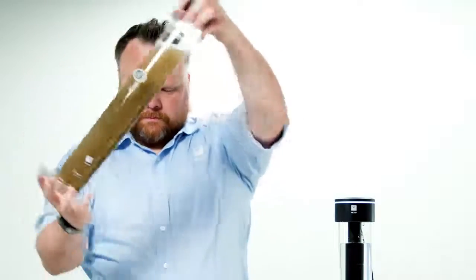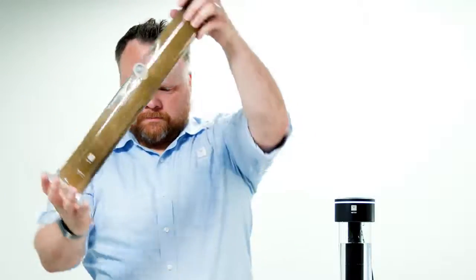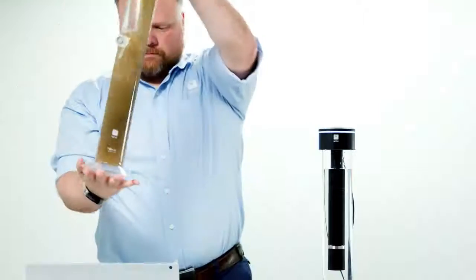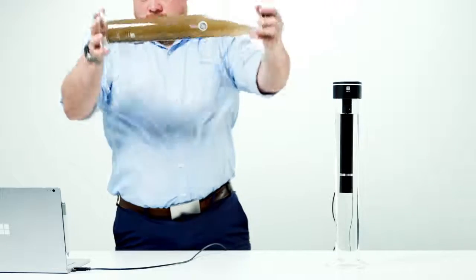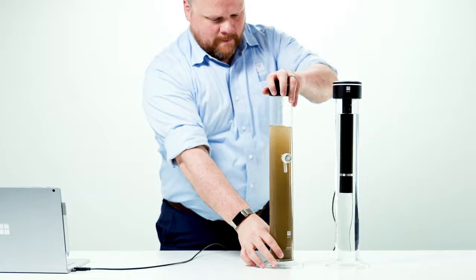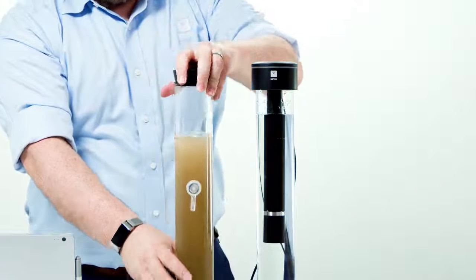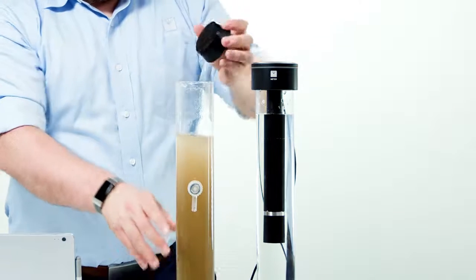With the rubber stopper in place, continually turn the cylinder upside down and back up. Same concept as overhead shaking. When the countdown in PARIO Control reaches 0, place the sedimentation cylinder on the level surface. It's important that the cylinder is on a level surface when the countdown reaches 0, because the measurement begins and the sedimentation starts. Place the sedimentation cylinder with the valve facing front, and remove the rubber stopper from the cylinder.